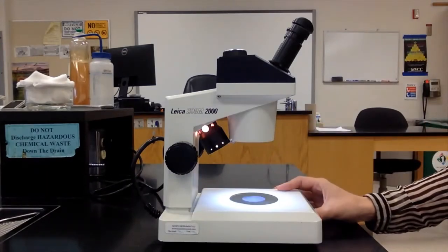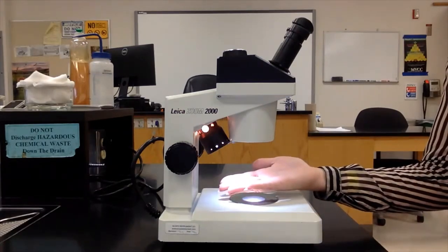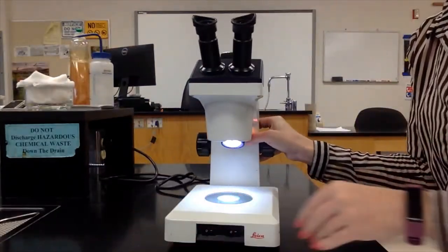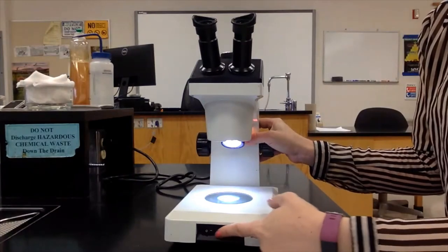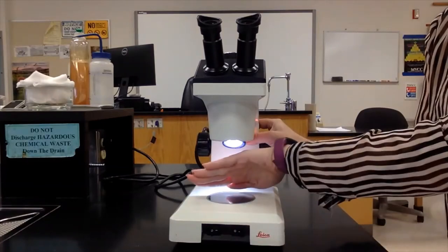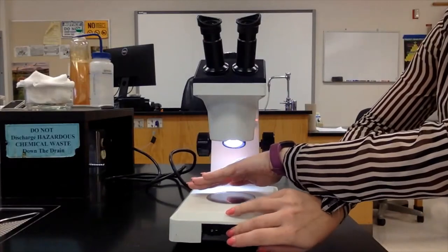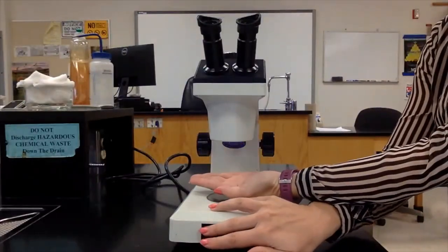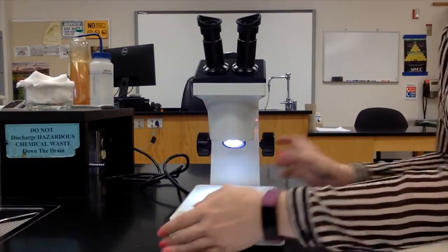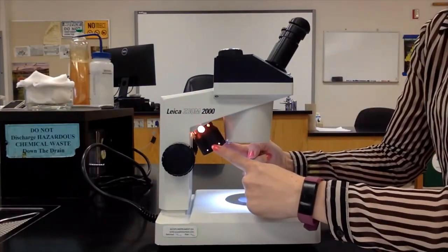We can turn the light on here, and you can see that it illuminates the stage. If I turn it like this, you can see this one has two lights — one from below and one from above. This lamp up here is the overhead lamp.